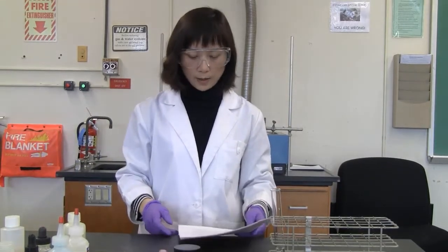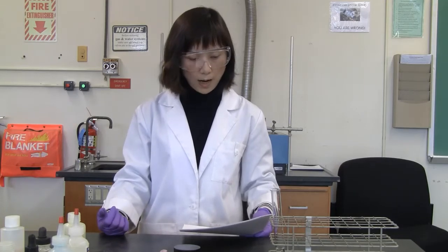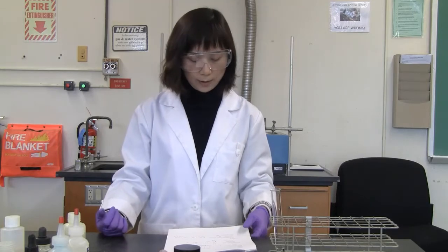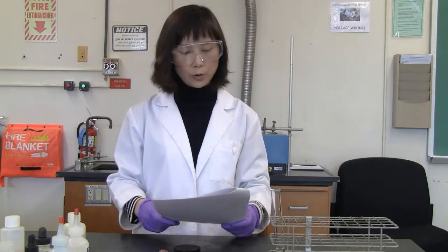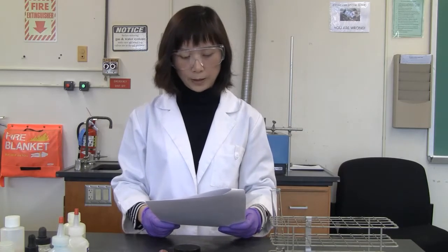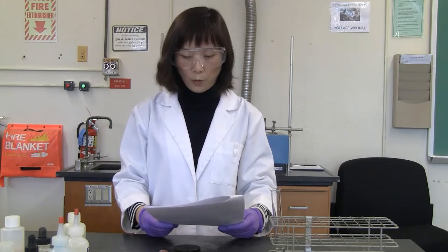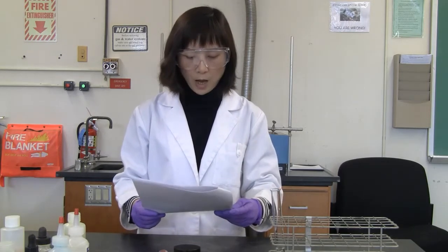All right, so here is the CH111 types of reactions 1. In this part, if you go to your lab report part, in your data sheet, for each reaction, you're going to write down the observation in the middle. Those observations will be based on color change, any precipitate (PPT) formed, something insoluble, any gas bubbles formed, or any temperature change. Of course, if there's any temperature change, I'll let you know. That's basically what you should write down in the observations part.